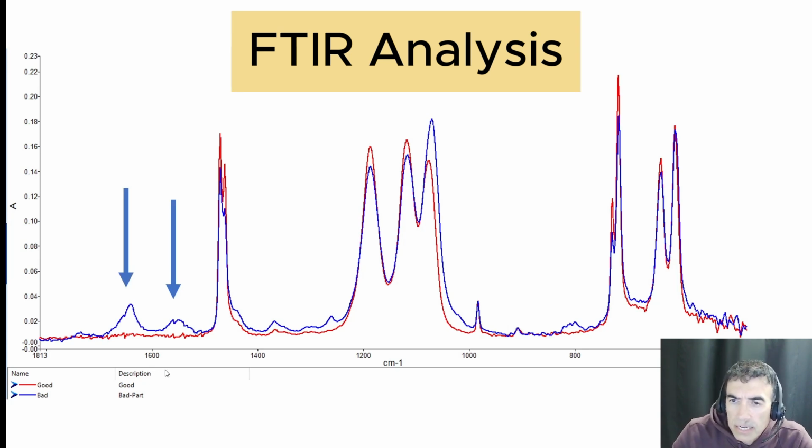The second test that is also very important for checking the degradation of the polymers is FTIR. We look at the fingerprint area of HDPE compounds, and we can see that for bad resin, we have significant peaks in the carbonyl region. We have two peaks in those regions that are a sign of oxidation. When oxidation happens, carbonyl groups form and result in those peaks.